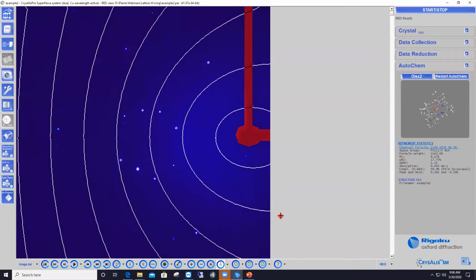Okay, so the first thing I'm going to do is play that dataset as a movie, so you see what's going on during data collection. You can browse through images of a dataset in CrysAlisPro using the buttons at the bottom left of the CrysAlisPro interface. If I click on the double arrow button with arrows that point to the right, I jump to the next image one at a time. If I click on the next button over, I jump 10 images at a time.